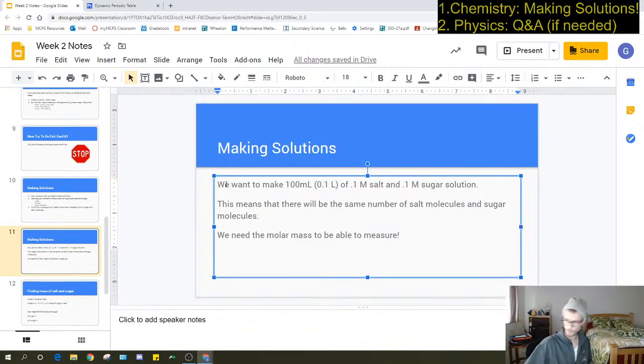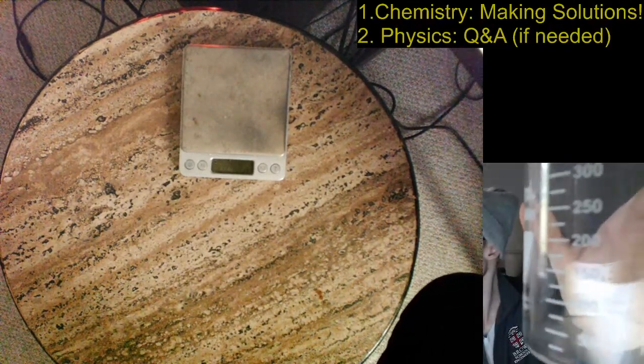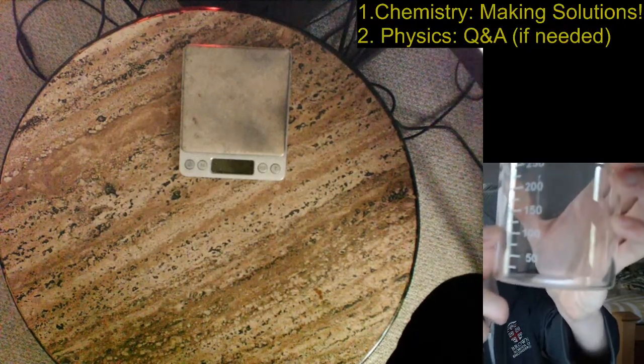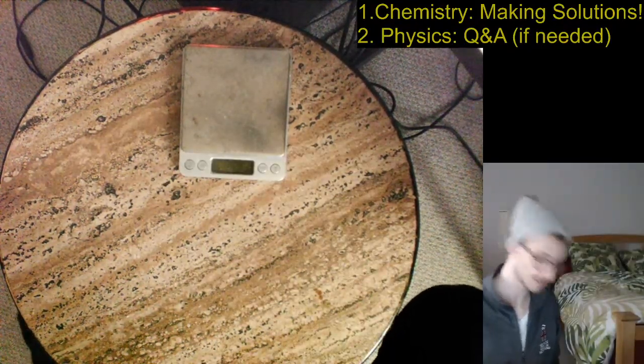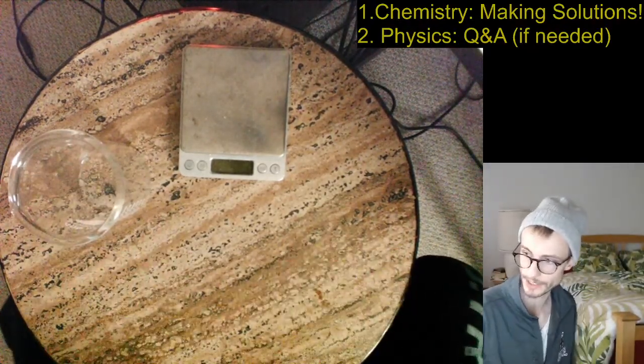So let's say that we wanted to get 100 milliliters, or 1/10 of 1 liter, of this solution. So I have here a beaker. Let's see if this is any better. You can see a beaker here, and it's got a 100 milliliter mark right there. So we're going to use that to measure out 100 milliliters of our total solution. I'm going to put that over here in my little work area.